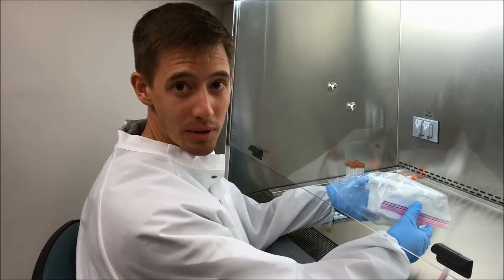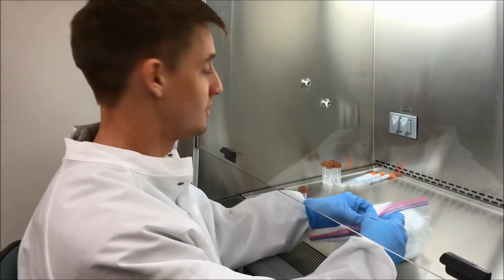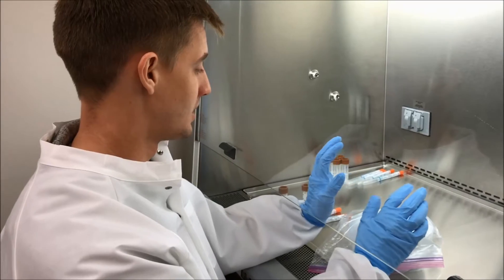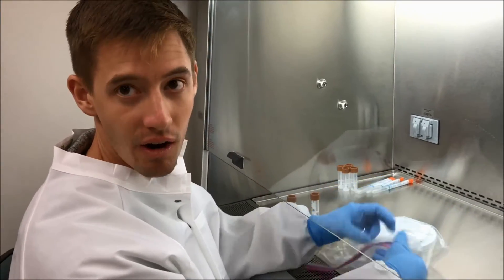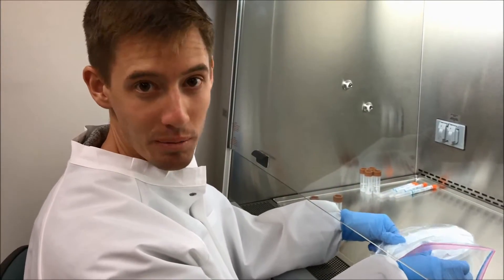So we received this bucket of stool, FedEx dropped it off, and now what we immediately do is aliquot the stool in the form that we want to process it later on, instead of having it freeze and then dealing with thawing and chipping away at frozen poop. It's just not fun.